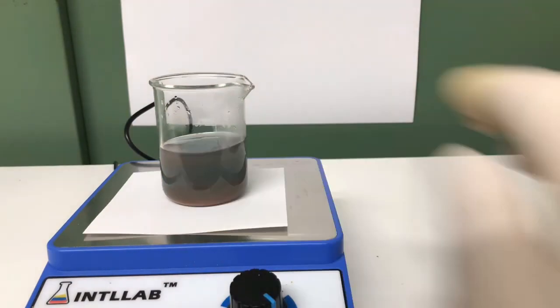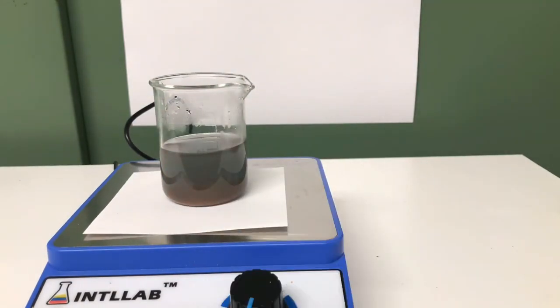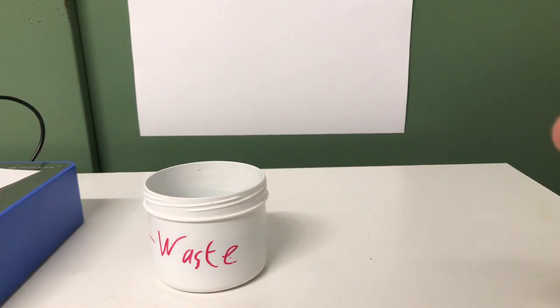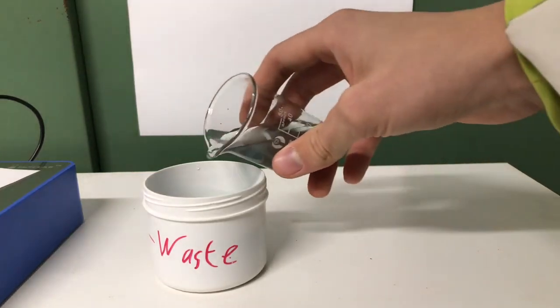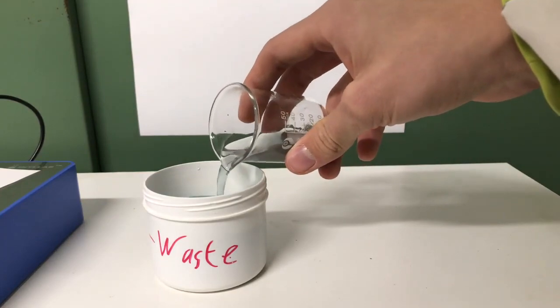Our solution will lose its blue color from the copper over time. Here you can see that our solution is now nearly colorless.